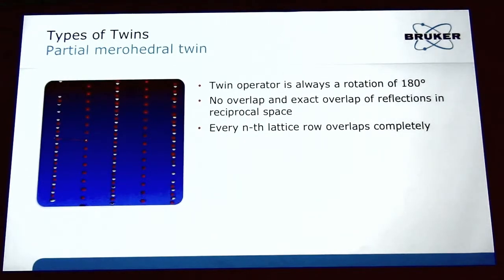One interesting one is called a partial merohedral twin. And this is kind of interesting because in this case you have complete overlaps and no overlaps between the spots. And they'll happen in rows or layers. So if you're looking at your spots, you see that the red here, those are complete overlaps, and then the next layer over are non-overlaps between the spots. And something like this would have what we call an index of 2. And so it's kind of interesting that you get this pattern of every other layer, complete overlaps and no overlaps.